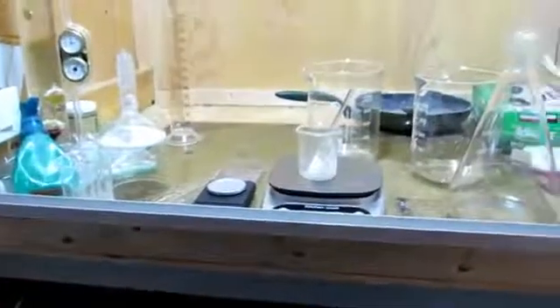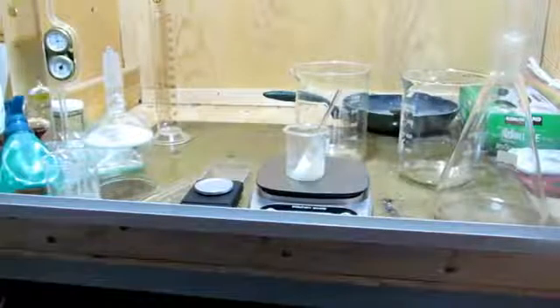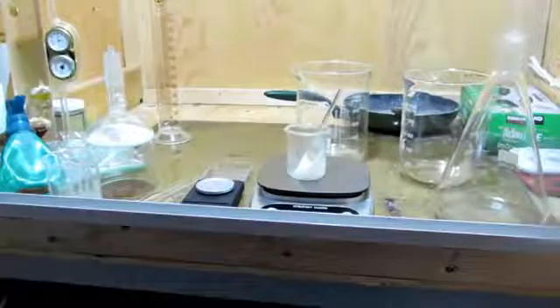Okay, so I left the beaker overnight, which wasn't exactly the best, and I forgot to cover it, so it did absorb some water. That's not the end of the world, however, and you can see it's just a bit of a gummy paste, but we should still be able to get a decent idea of what our percent yield is and everything.